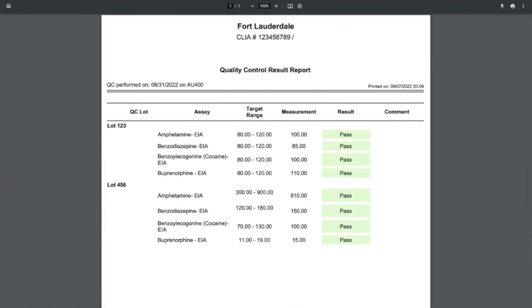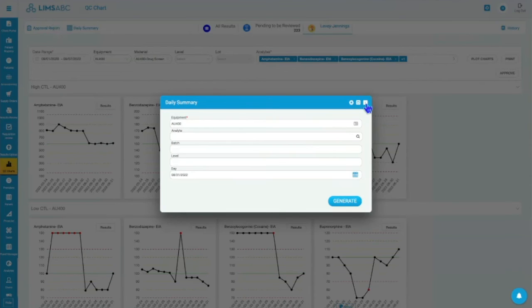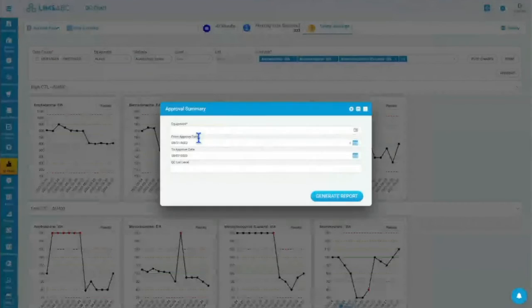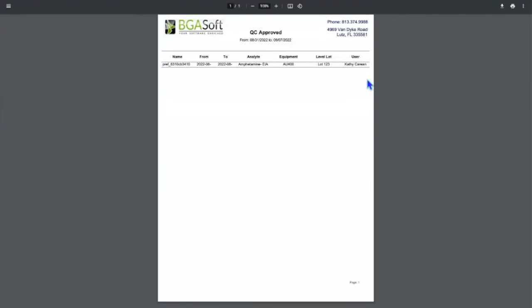So that is the daily summary. I am not 100% sure about the daily approved. This shows you all of the QCs that have been approved and who approved them and when, right? So this gives you your approval.